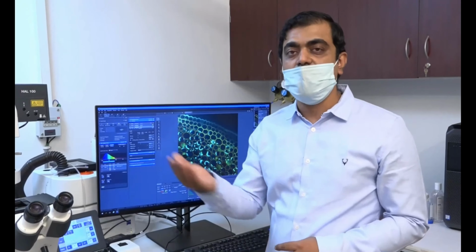The Z is being taken, and as it is acquiring more and more, you can see the progress happening. So as you can see, different Z positions in red channel are being acquired, and for acquiring, hardly 3 minutes is being used.